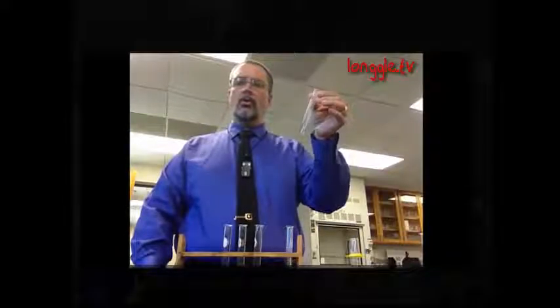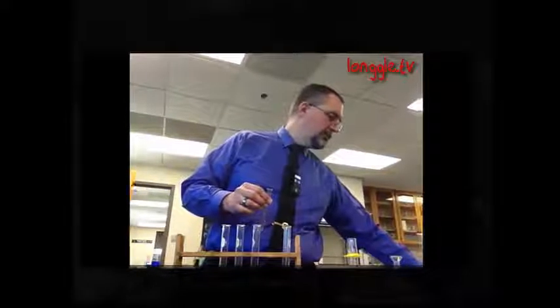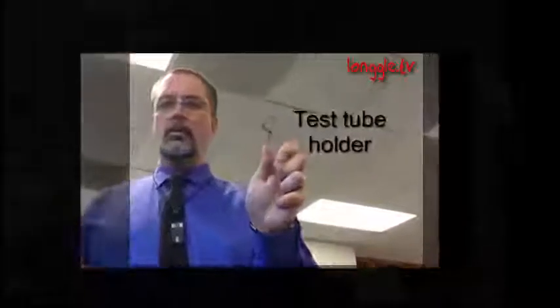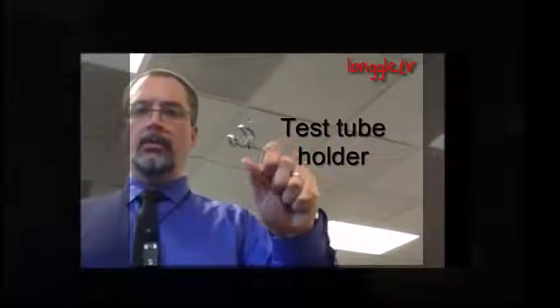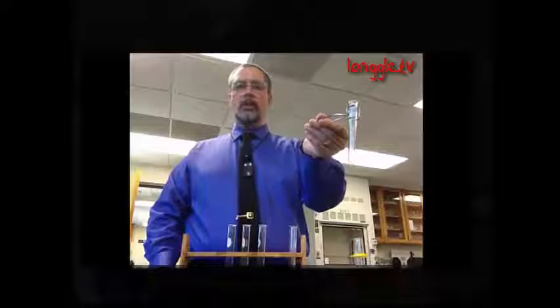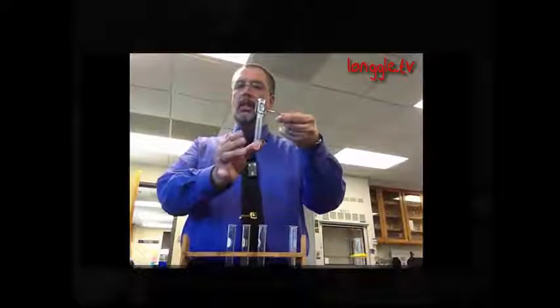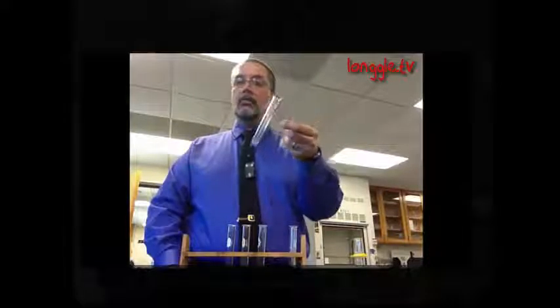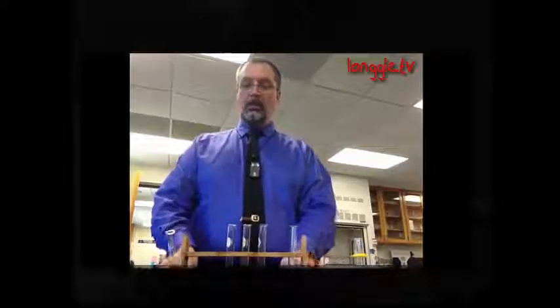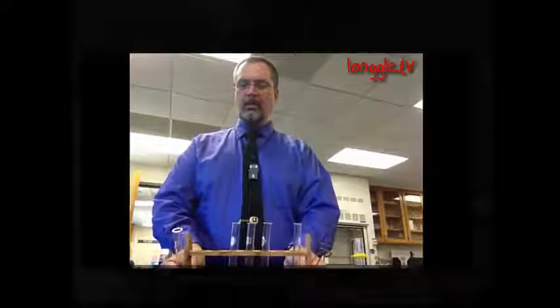And if we want to hold a test tube, we're going to use a very specific piece of equipment called a test tube holder. This is a test tube holder. You squeeze it together like this, the jaw is open, you can put your test tube inside like that, and now we can hold the test tube securely, but without having to actually touch the glass in case there's something very hot in here or if we want to put it into a flame and heat it. Test tube holder, test tube rack, test tube.